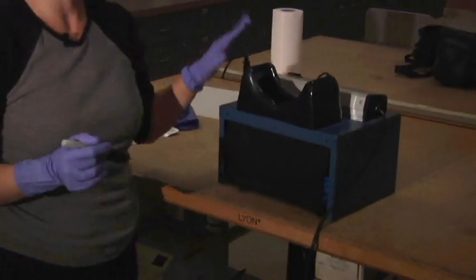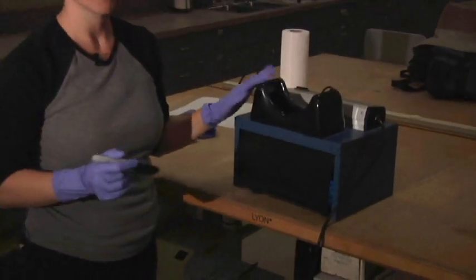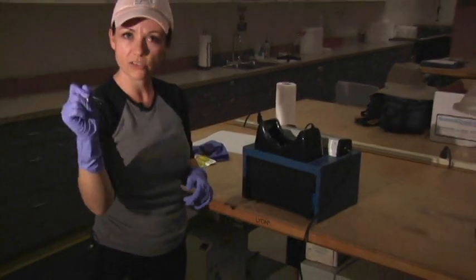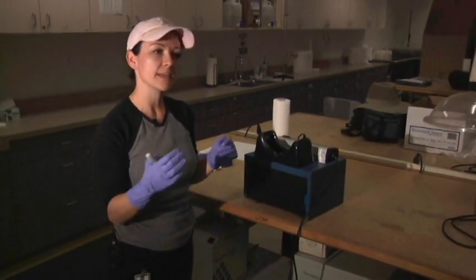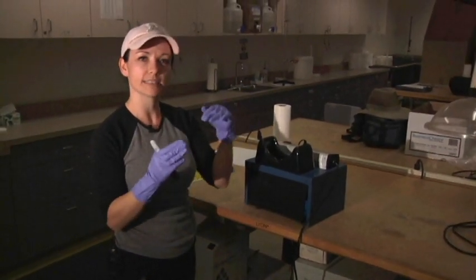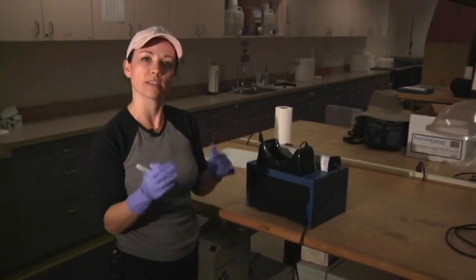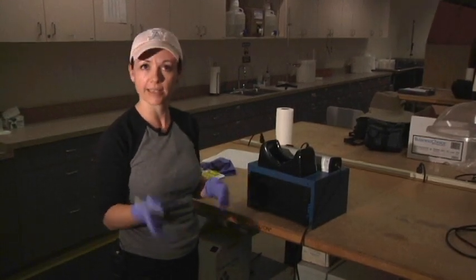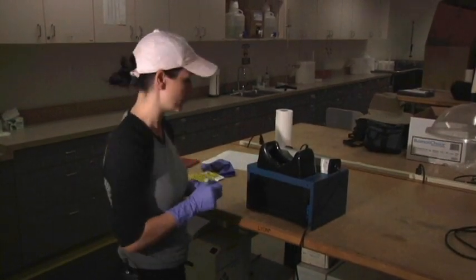It's been 24 hours and we're ready to check our E. coli sample. I've taken it out of the incubator and placed it under this UV light. What I'm going to do is mark each cell that is fluorescing, and then we'll go back and look at a table and equate it to how much E. coli was in the stream at that time of sampling.